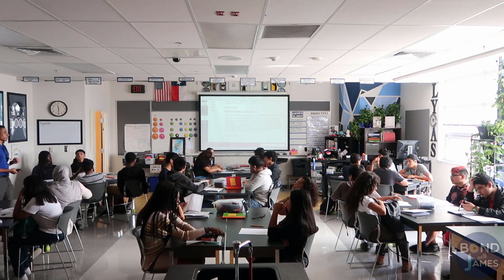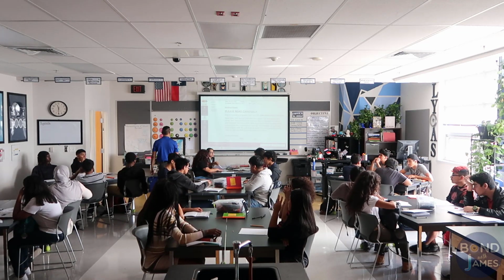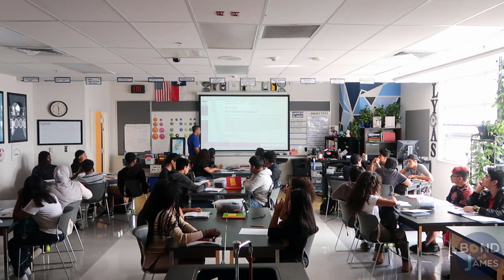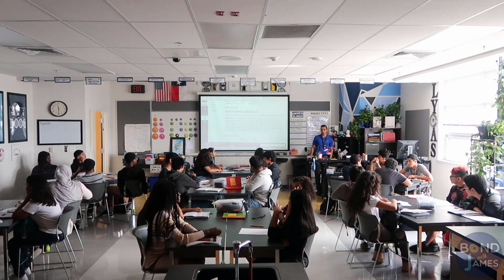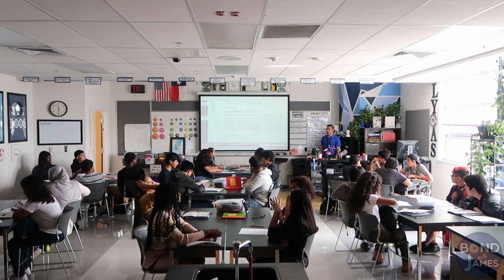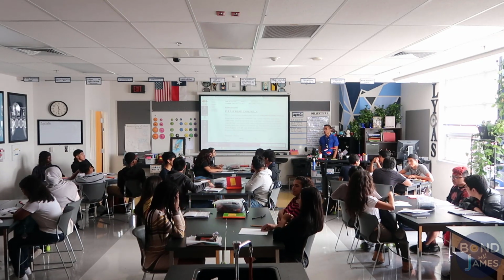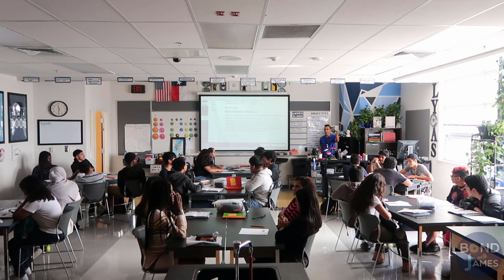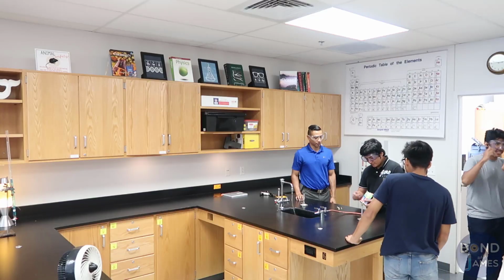The other thing that we're doing is, if you have your safety contract, because I'm going to teach you how to light a Bunsen burner, and yes, you will light a Bunsen burner. At some point, you'll either do it by yourself. So yes, that's what we're doing today. I'll call you table by table and have you come to the back, but the rest of you will stay up here in the front and do it.